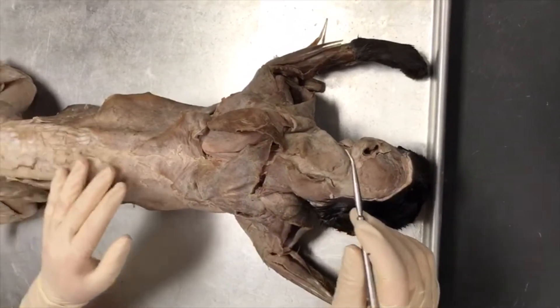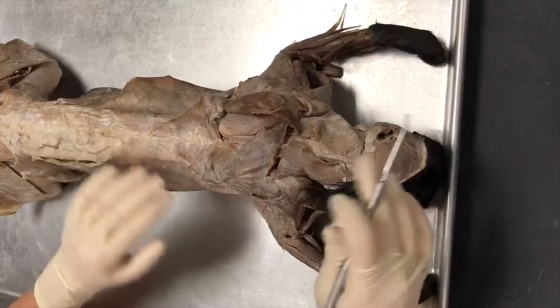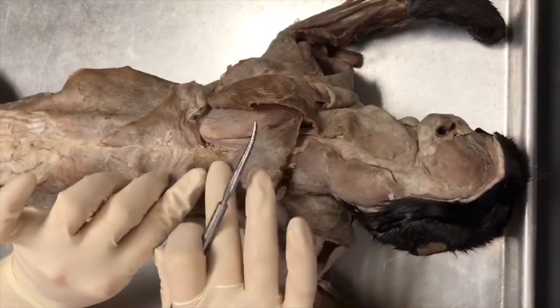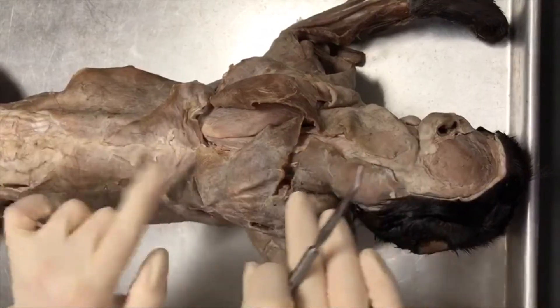We're going to review the back shoulder and dorsal neck of the cat. We're going to start with your trapezius — this big muscle here that's split into three different sections.